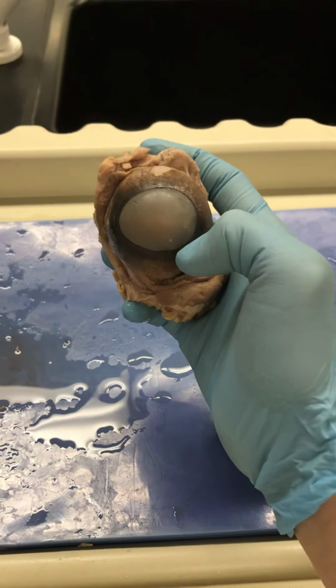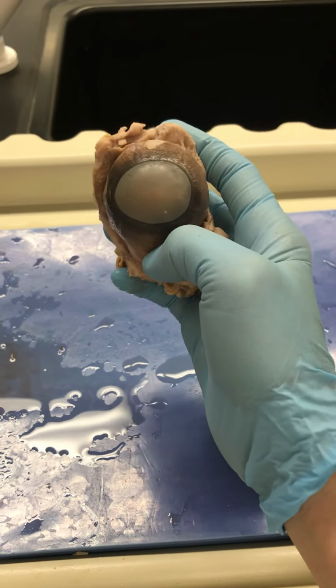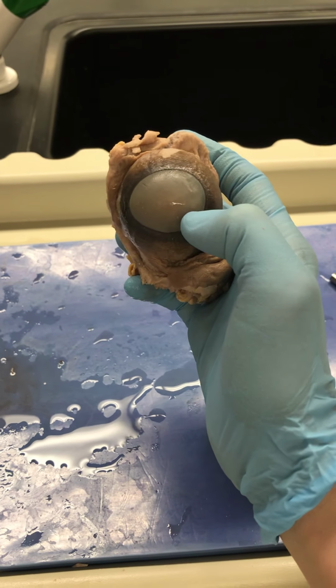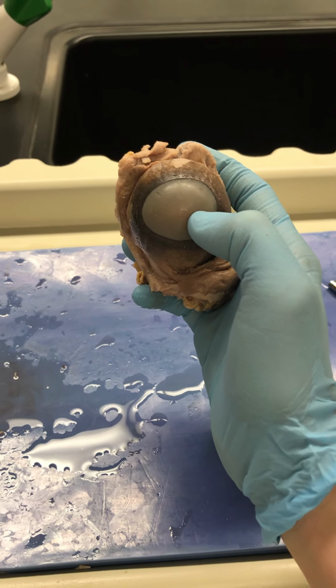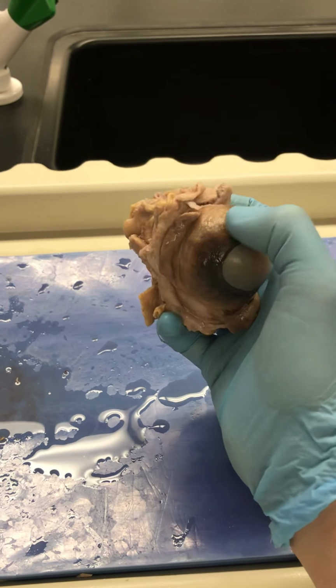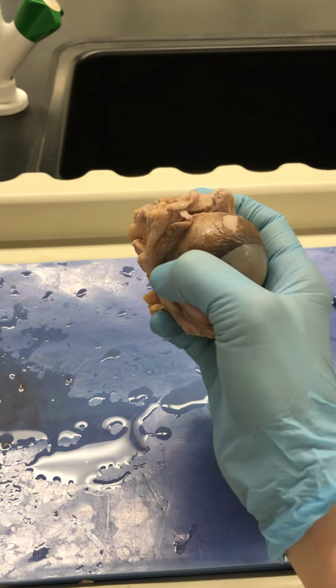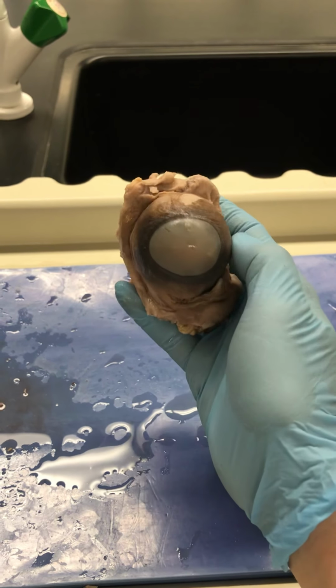So we'll take a look at that in a second, but that's what it would look like if you can visualize it, and notice that there's pressure there. That's because of the aqueous humor, which is water in the eye. This is the sclera of the eye. So cornea and then sclera. Sclera means hard and tough.